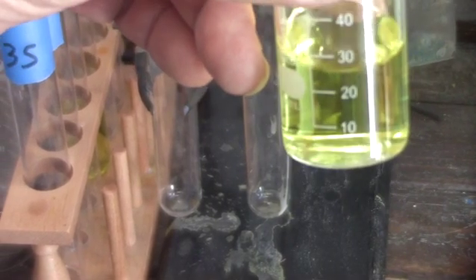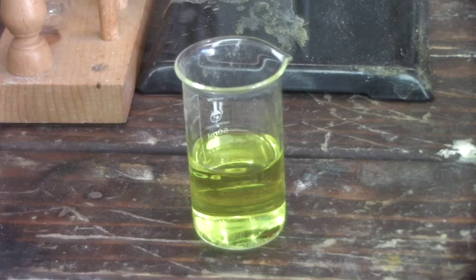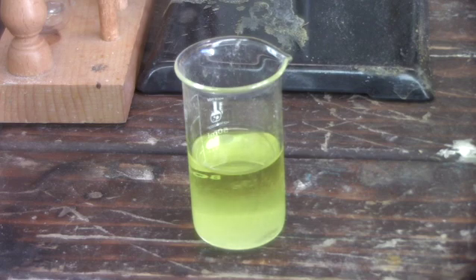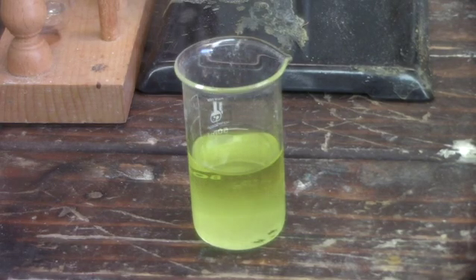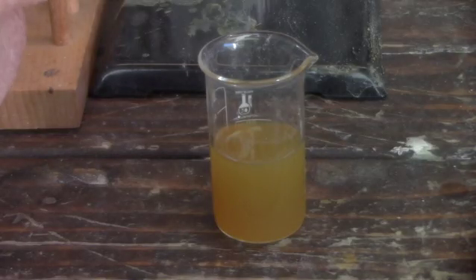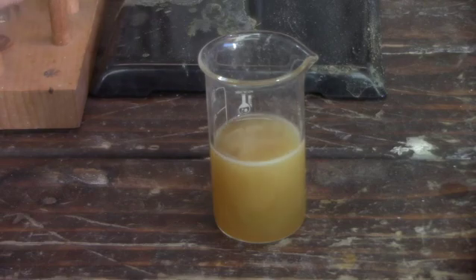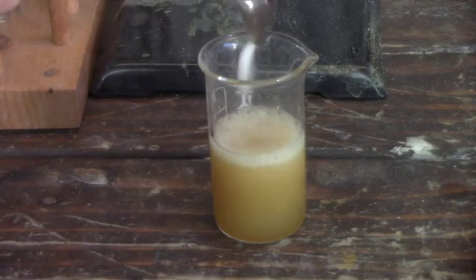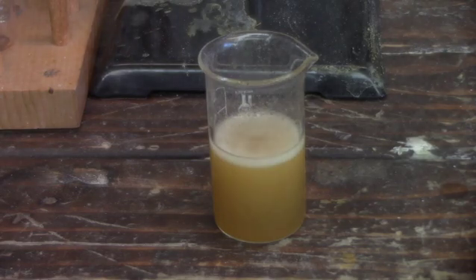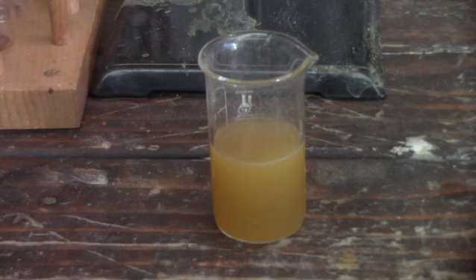Here's what's left of our sample — I added 10 milliliters of water to bring it up to 30, and we're going to try precipitating this now by adding some SMB. As you add SMB, if you don't see a sudden black cloud, don't worry — sometimes it takes a while. Usually if you have a small sample of gold, you'll need to let it set overnight. Keep adding SMB until the reaction does not happen at the bottom of the beaker but you get a white foam on top — that white foam indicates you're done adding SMB. At that point, set the beaker aside, let it react, and let all your gold particles precipitate. If the solution had not been denoxed thoroughly, we would have had to use a lot more SMB to get to this point.